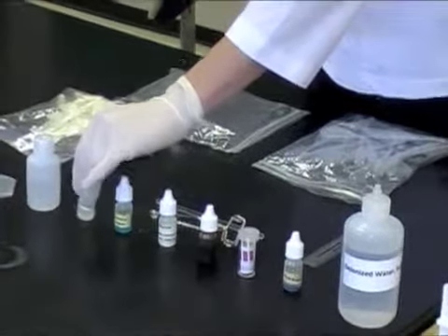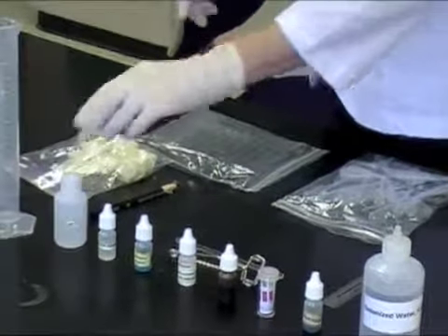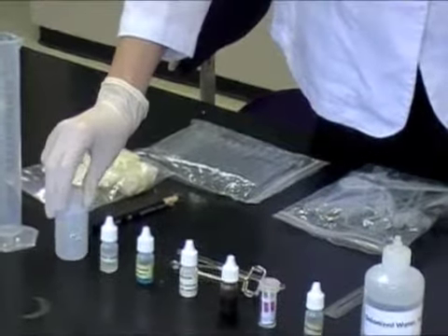You will have acidic solution, which is also hydrochloric acid. You also have a buffered solution. Its label is pH of 7.